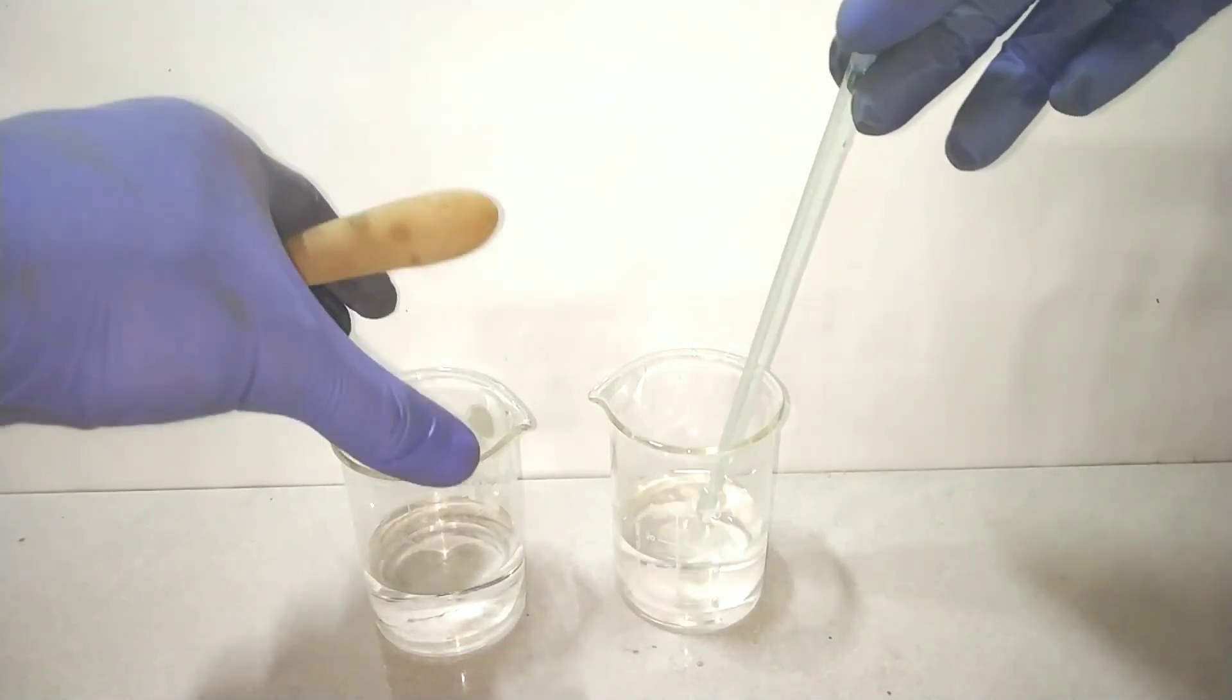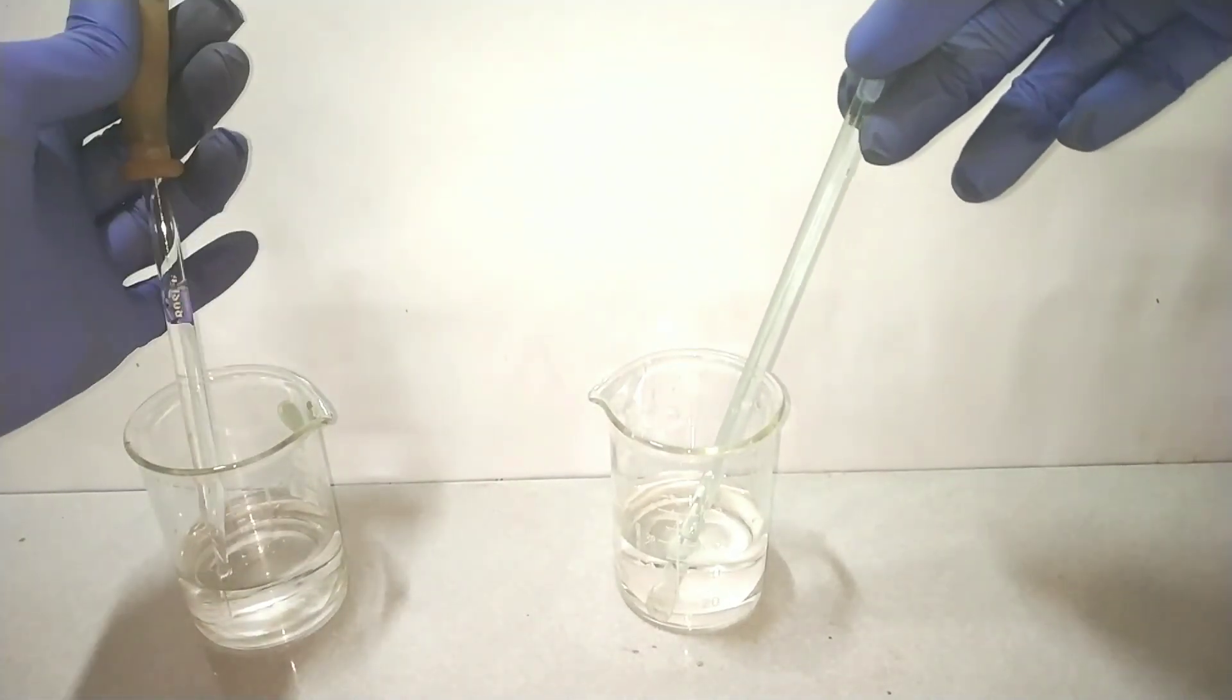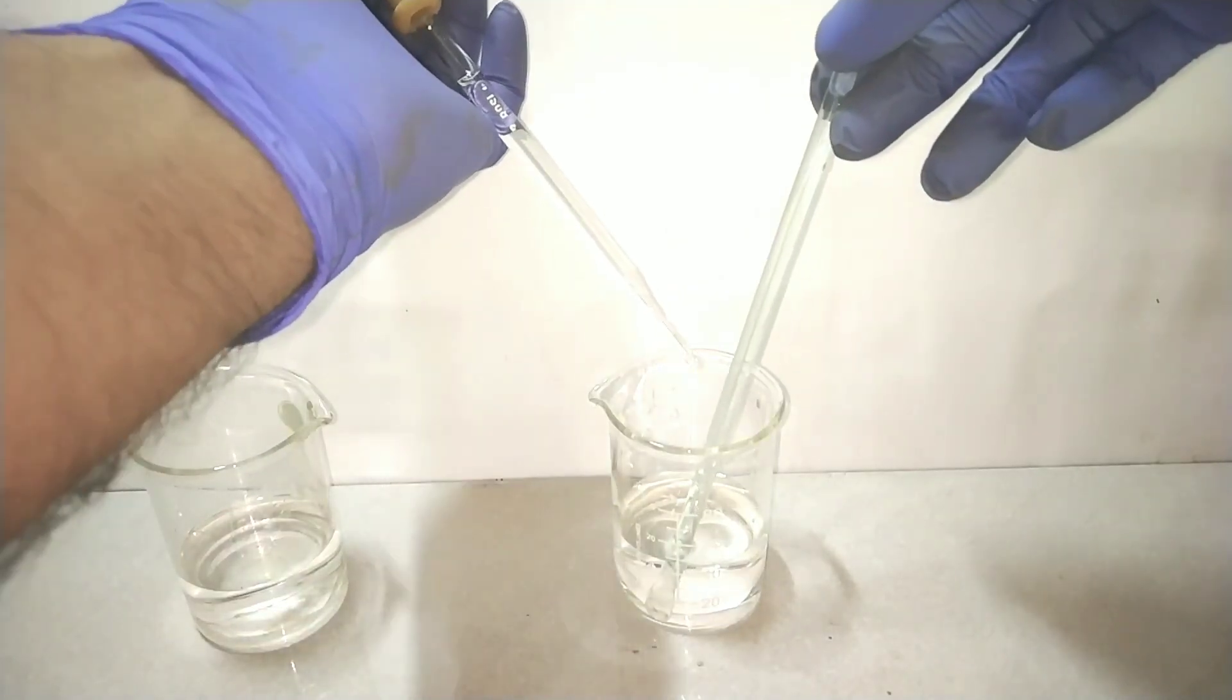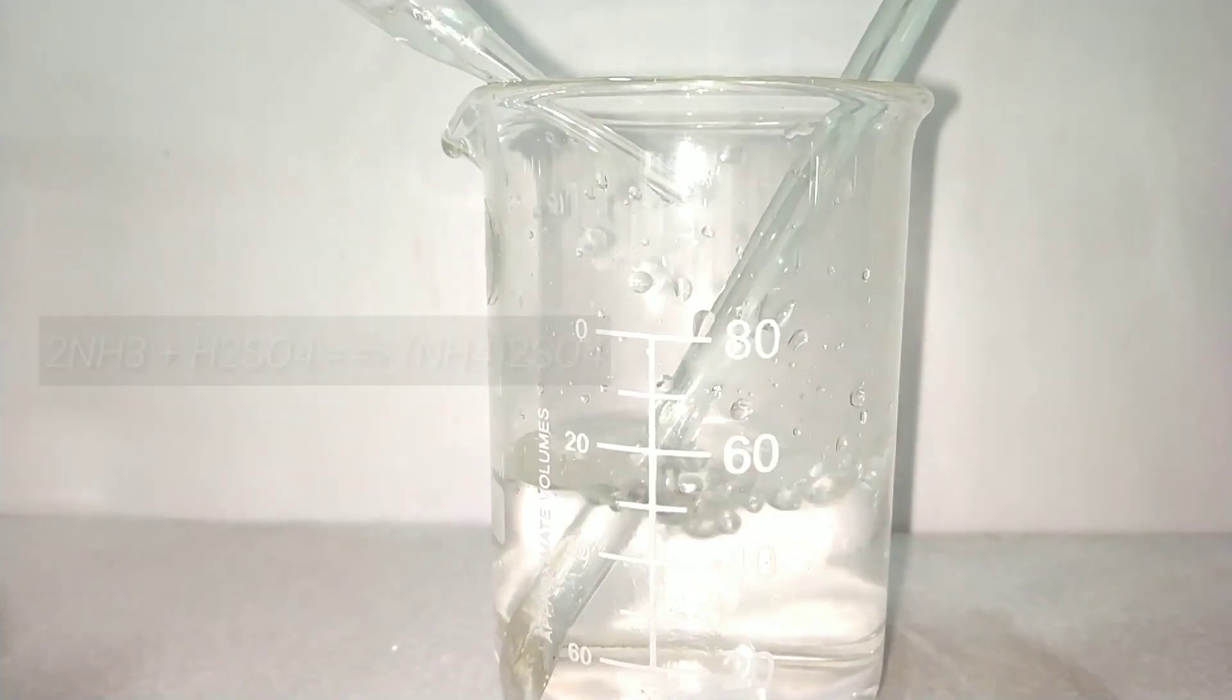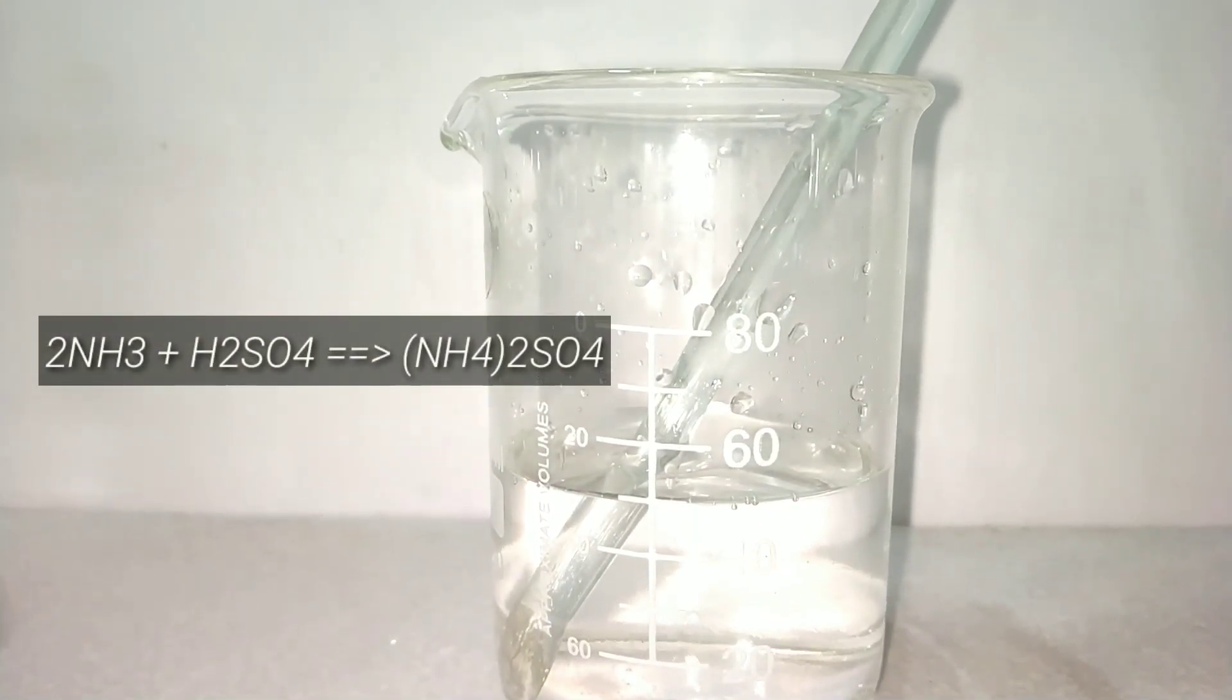Neutralization reaction is exothermic so I have to cool the solution from time to time because ammonium hydroxide is volatile and when the reaction becomes hot the ammonia gas will escape.